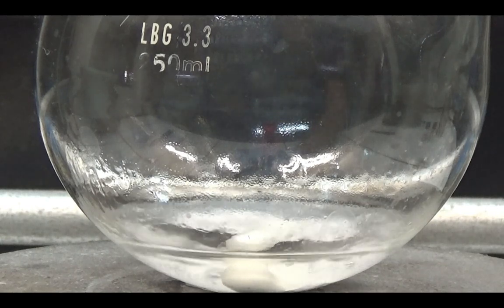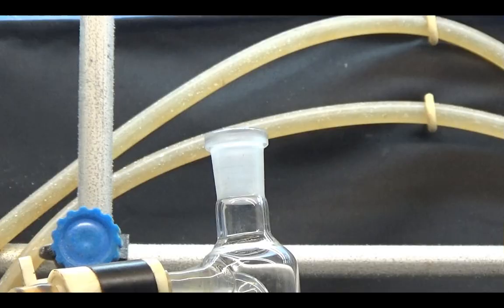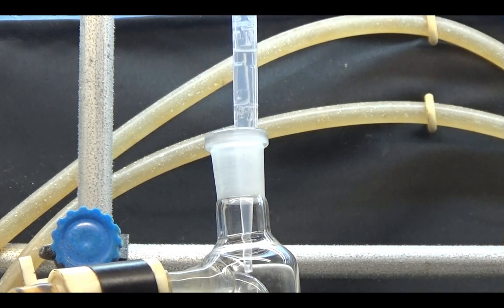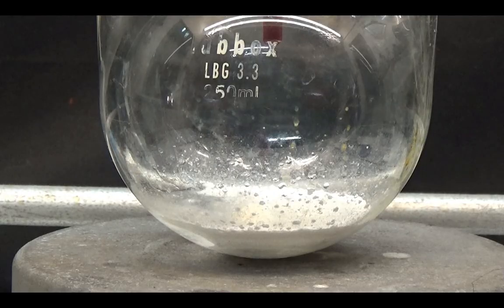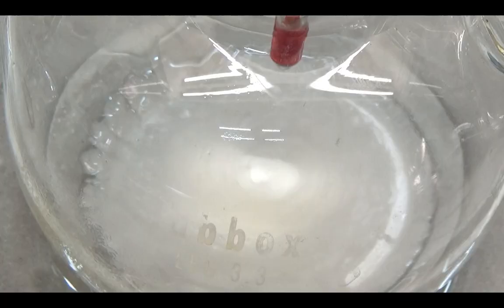Once the sodium is dissolved, a white salt remains. To dilute this salt, we slowly add 25 milliliters of 99% ethanol through the condenser and a suspension of sodium ethoxide must form.